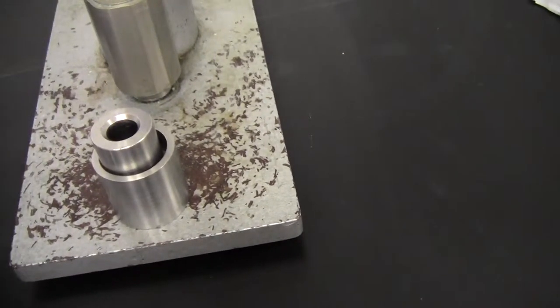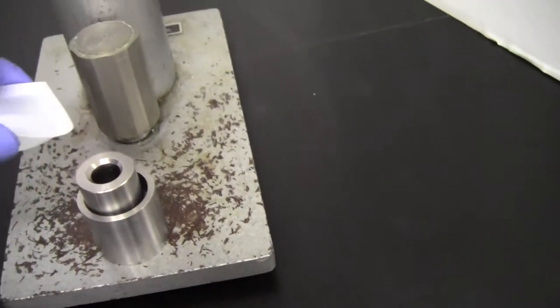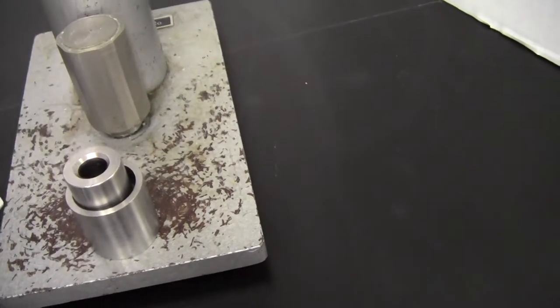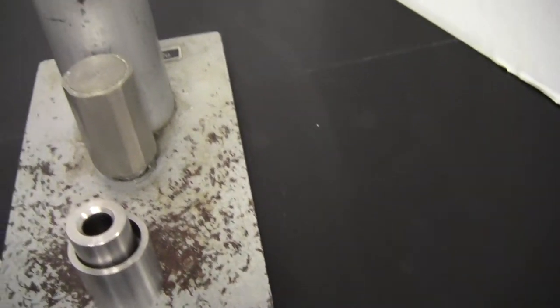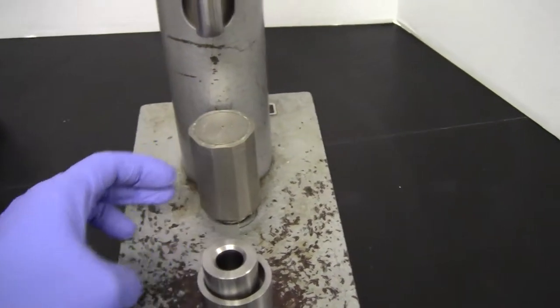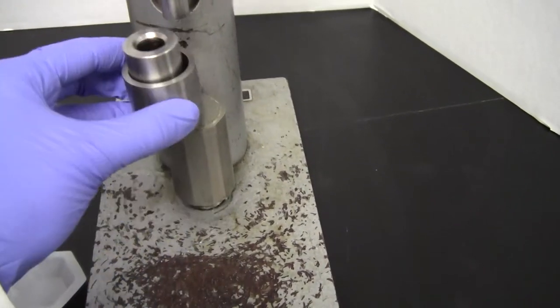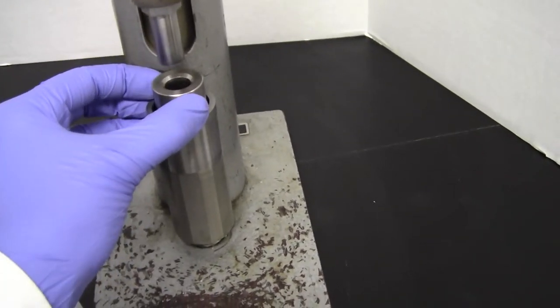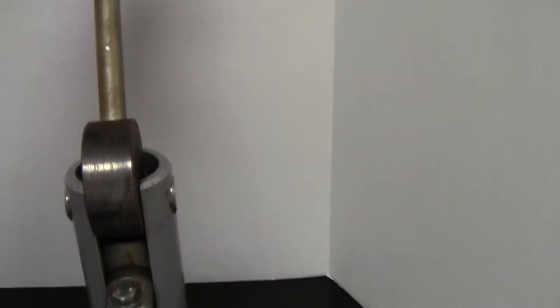And then take your benzoic acid and curve the sides a bit here and put it in. I'm pretending I have a sample. And then we're going to mount it in place. Make sure that's in the center, and then grab the handle.